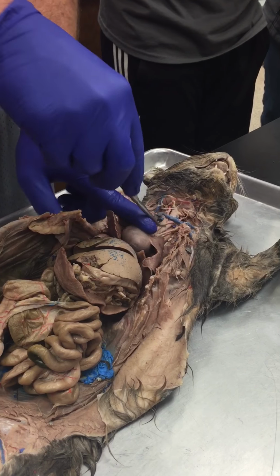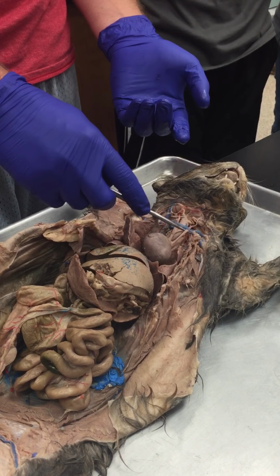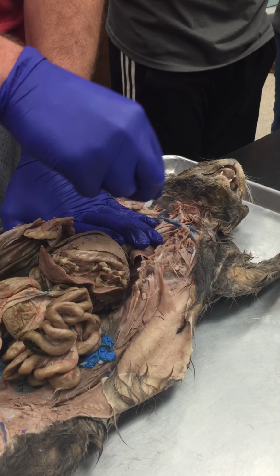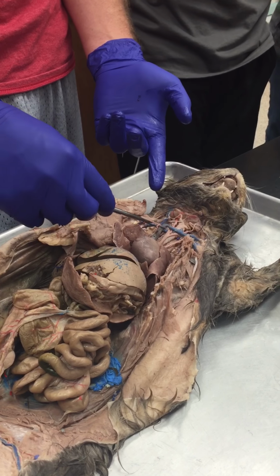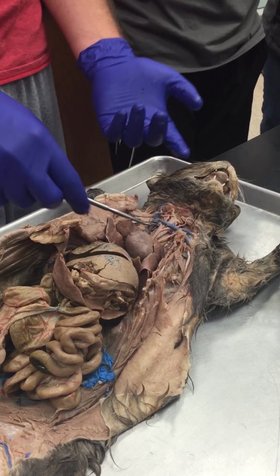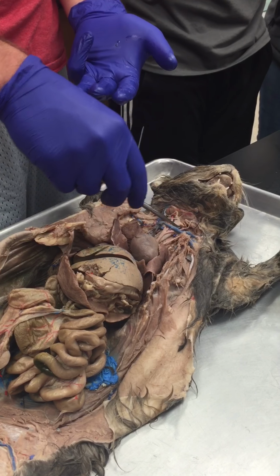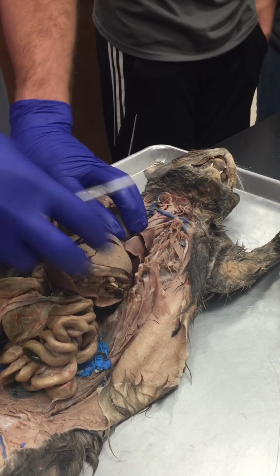Now going back to the aorta, we look at the second branch off of it. This is going to be the left subclavian. So if we follow this up, we'll see that it goes off into the arm. It's kind of hard to trace, but this one will go off into the arm. And so it's the same thing as the right subclavian, except it's coming straight off the aorta. Okay? So you have your brachiocephalic branching 3 times to form right subclavian, then right and left common carotid, and then the left subclavian going to the left arm just branches straight off the aorta. Okay?